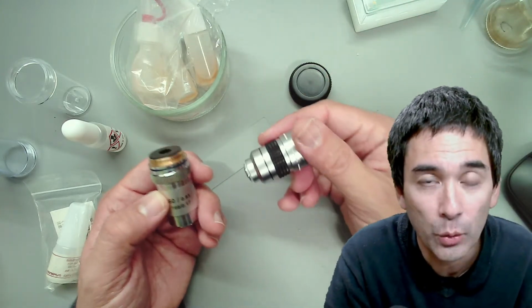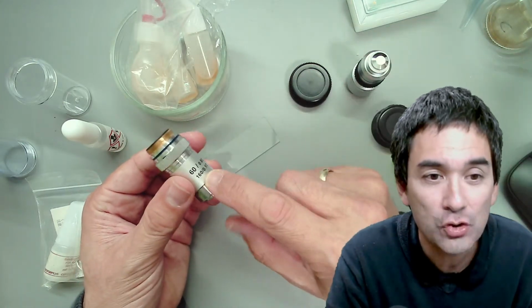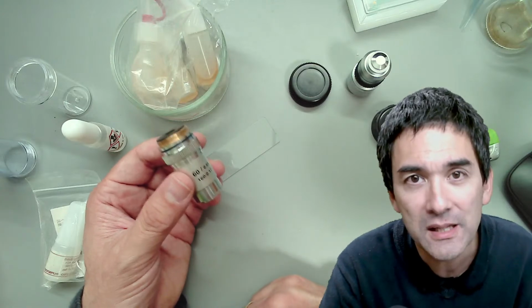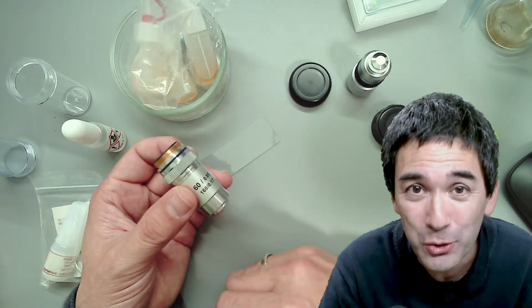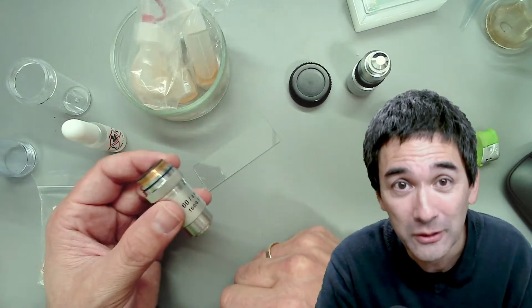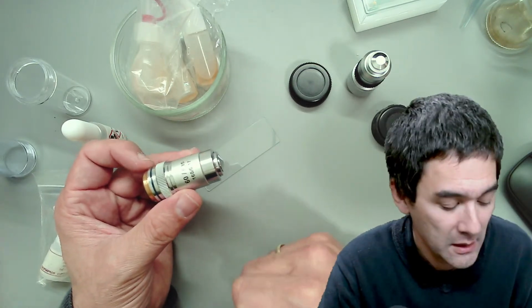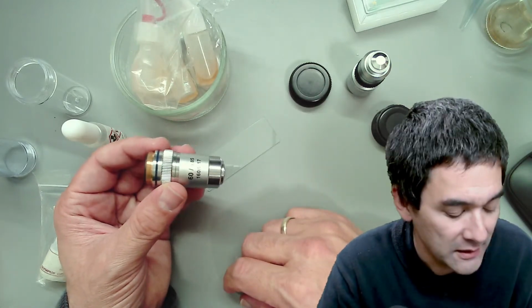Many of you will already have a 100 times oil immersion objective because it came with your microscope. But generally, I would say that exchanging it with a 60 times dry objective, the regular objectives are called dry objectives, has a wider use, because you don't have to use immersion oil. Once you've got oil on the slide, you cannot switch back to the lower magnifications, because there's simply too much of a risk of contaminating the objectives and then damaging them. So we have to be a little bit careful here, and it's a slightly more advanced technique.